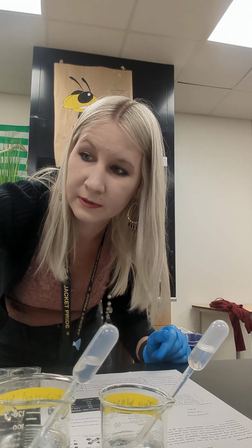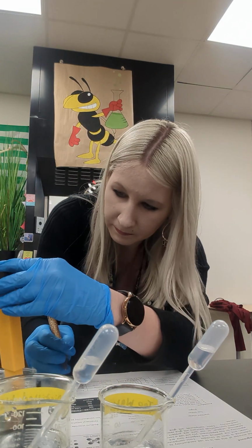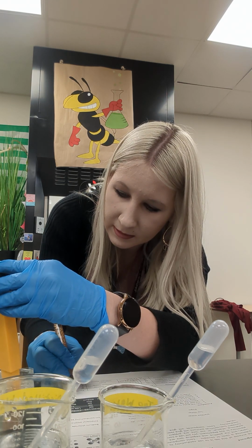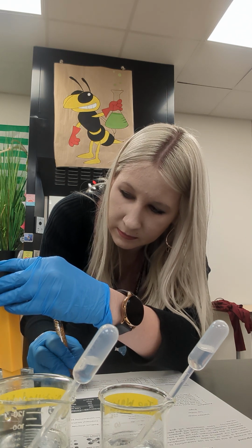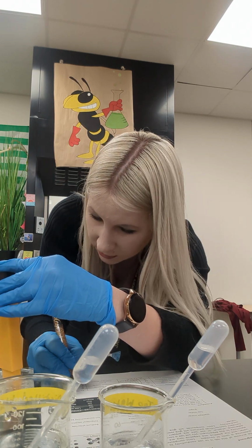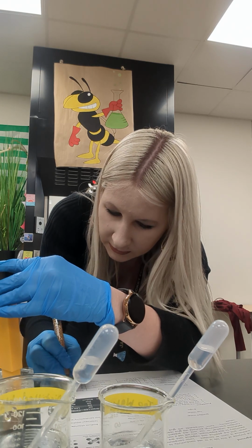We want to make sure we go into 0 in between. Sodium chloride. That is a 1300 and climbing. Be patient. 1400 and climbing. Still going. Sodium chloride is a strong ionic compound. 1482.